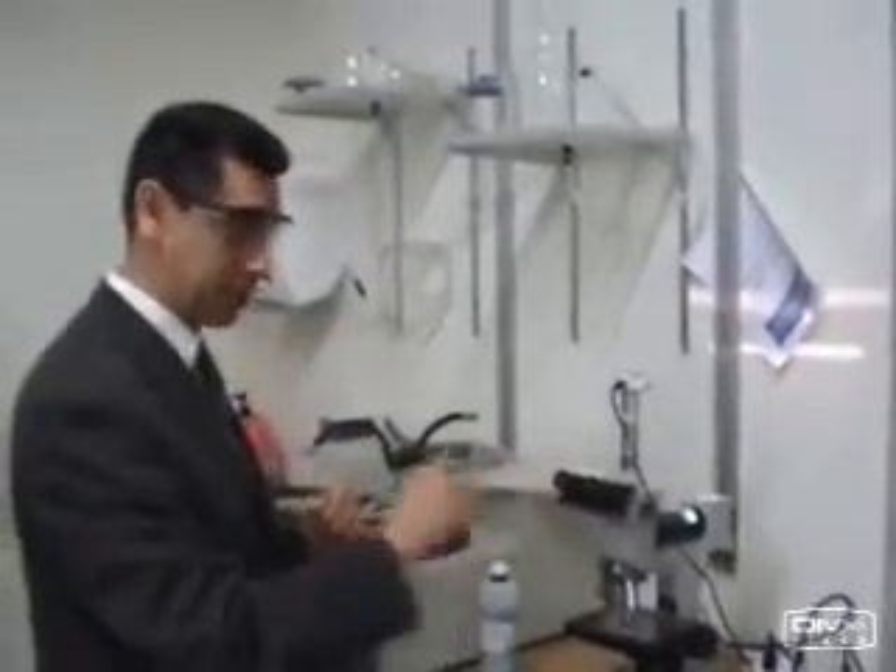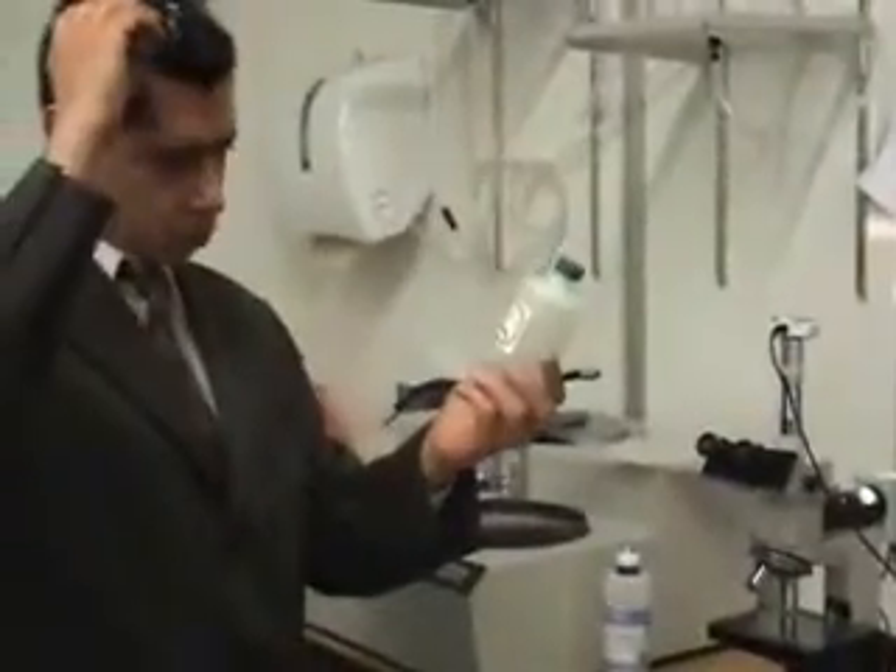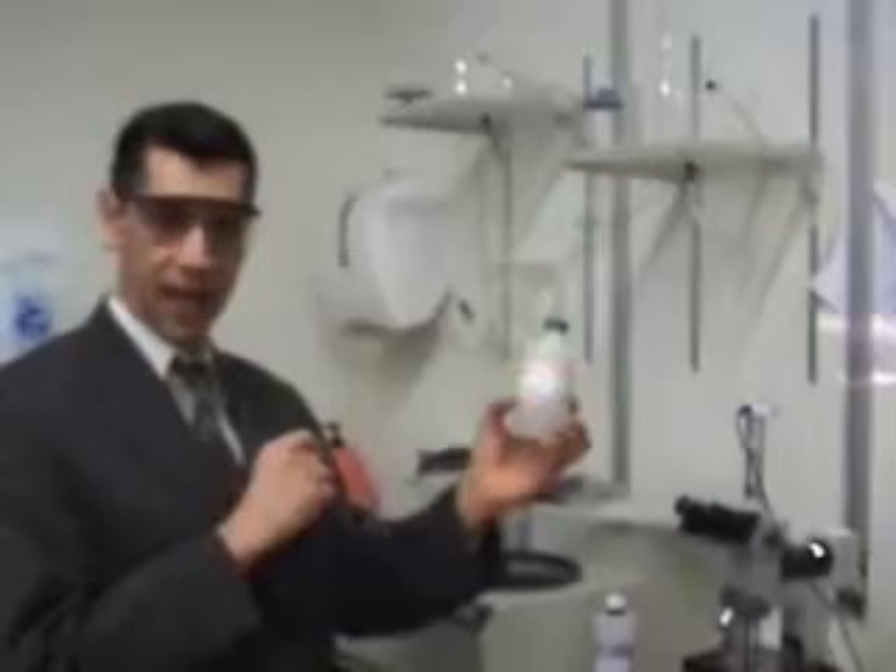Now that I've polished the sample, as you can see, the sample has fewer superficial scratches. I am at 40x magnification here. Cranking up to 400x magnification, we can see the surface of a polished specimen — there is no grain boundary and no structure. The next step is to etch the sample. For this, I'm using nital 5%, which is a typical metallography etchant containing 5% nitric acid with the remainder being methanol.